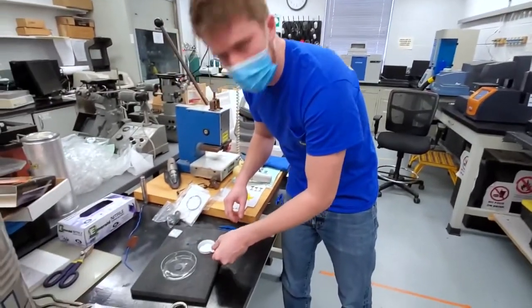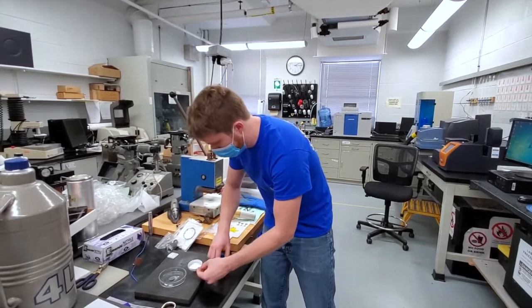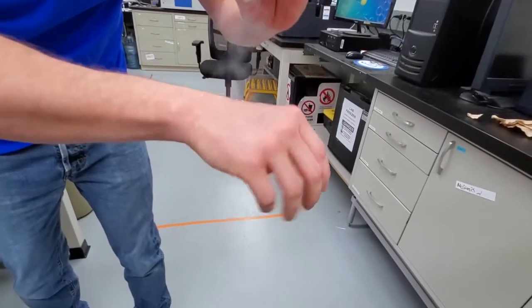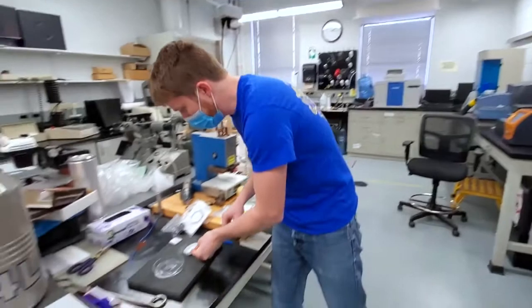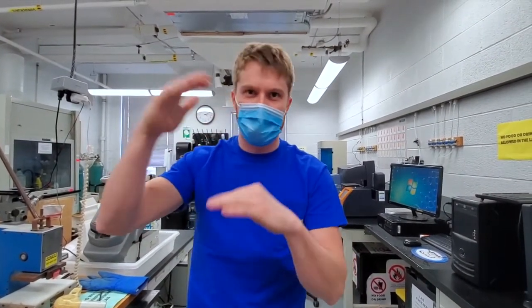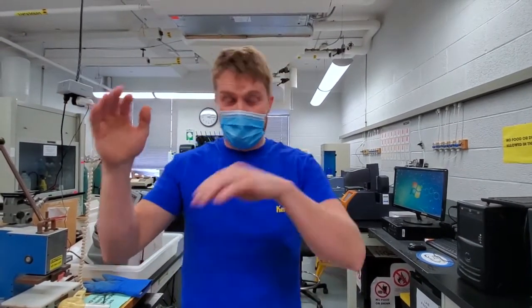And liquid nitrogen is very cold. If it's in contact with your skin for a long time, it can hurt you. But if you just pour it on top of your skin, it just rolls off immediately. So what's happening there is as soon as the liquid nitrogen contacts your skin, it vaporizes, turns into a gas, and that layer of nitrogen gas actually protects you and acts as an insulator between you and the super cold liquid nitrogen. That way it can just roll off your hand.